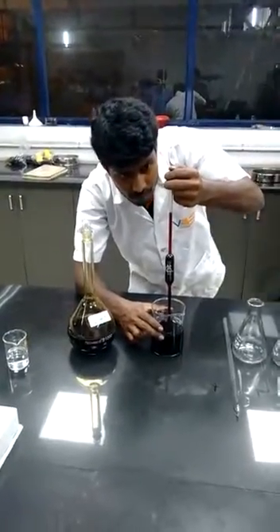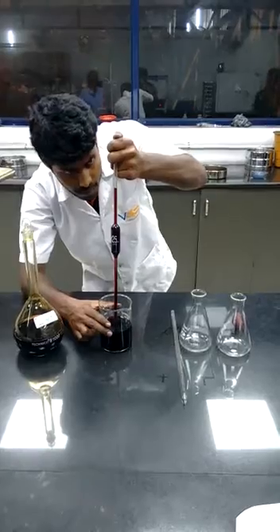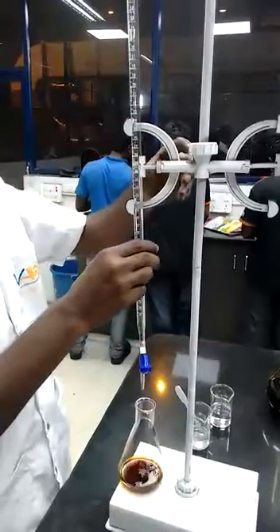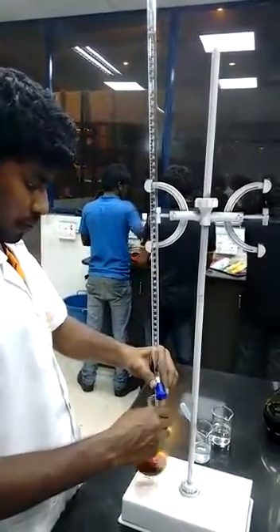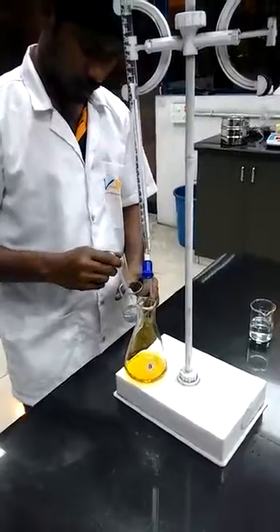Pipette 25 ml of iodine solution into the conical flask. Then titrate against sodium thiosulfate solution till the color changes to light yellow, then add few drops of starch solution into it.